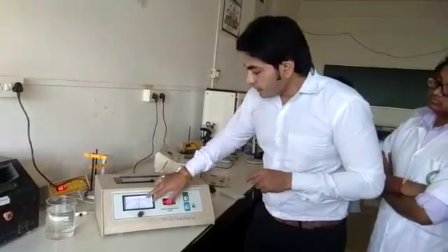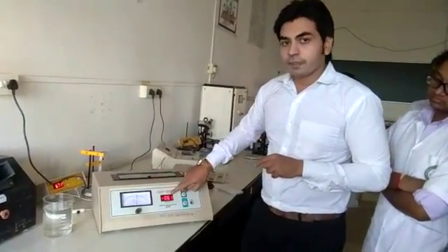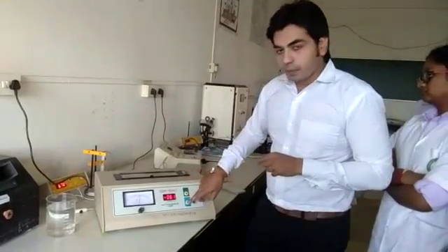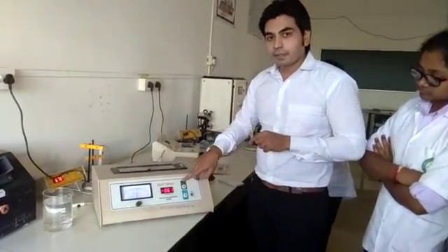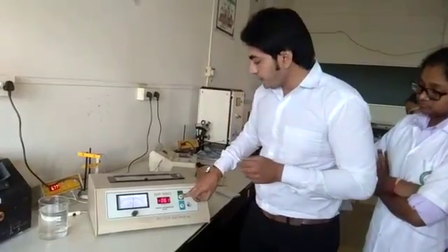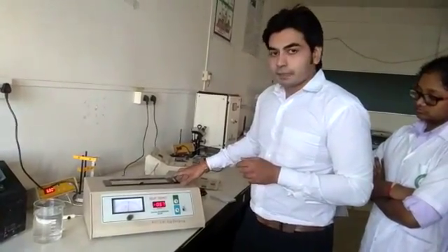This is the intensity meter. This is the display board where the optical rotation is displayed. These two are the calibration knobs — you have to calibrate this instrument before using it. And this is the polarizer wheel.